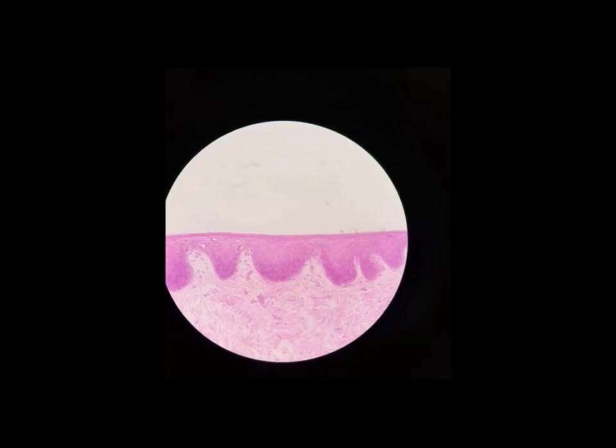And those cells are either dead or dying off. And that's what we want. It's not a bad thing that they're dead or dying, because the purpose of this tissue is abrasion resistance. It flakes away. For example, we find this on the surface of our skin in the epidermis, which is the outermost portion of our skin. We also find it lining the mouth, lining the esophagus, places where there is a lot of abrasion. Think about what happens when you scratch your arm.